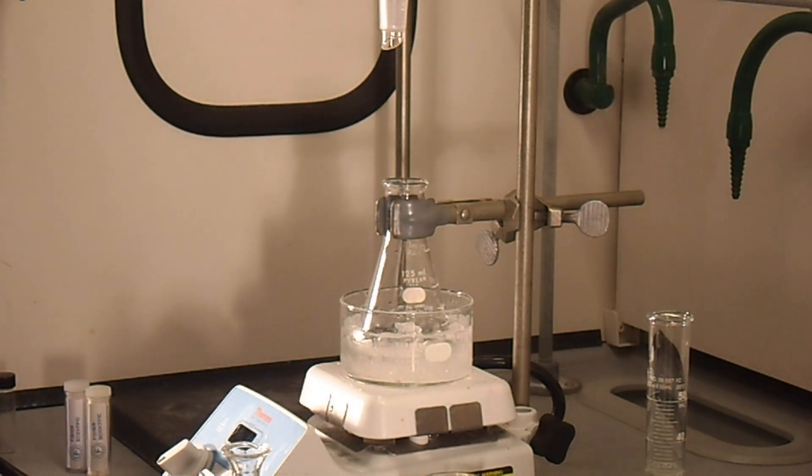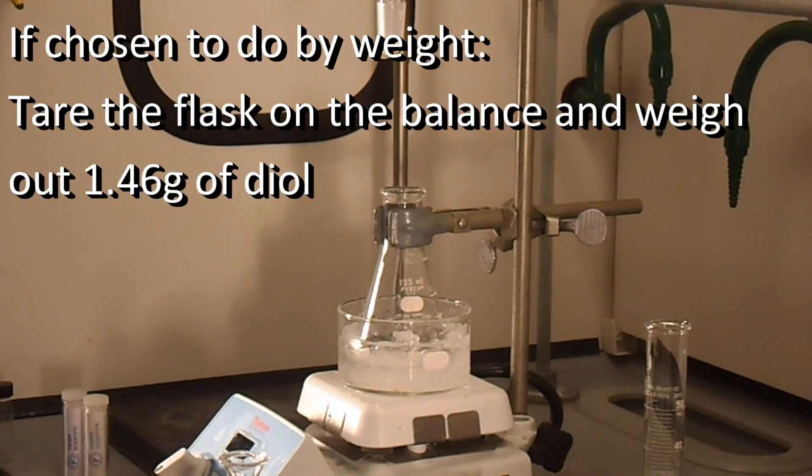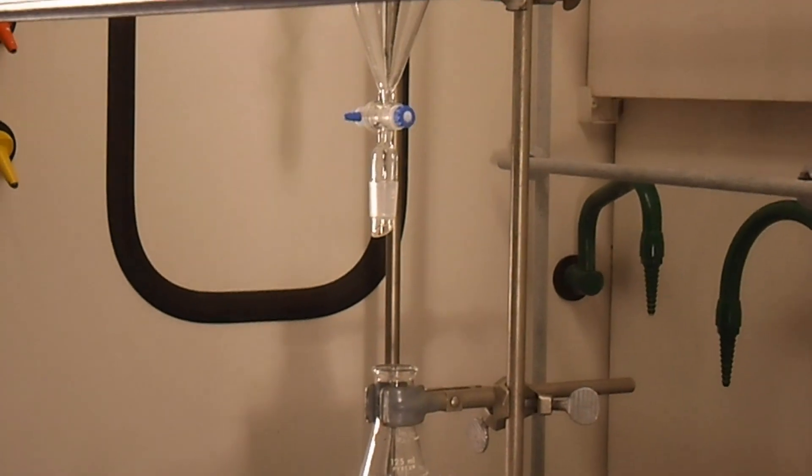So we have pre-weighed our diol using a graduated cylinder. You can also do this by weight, so that's already in our flask. We also have our separatory funnel already pre-set up.